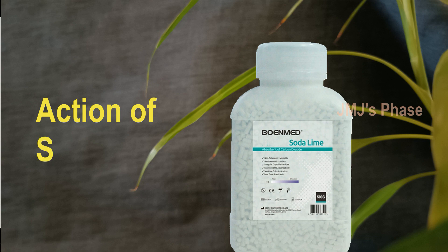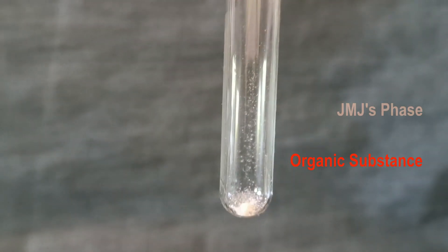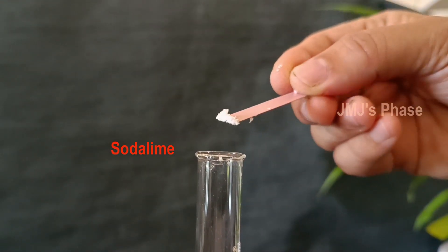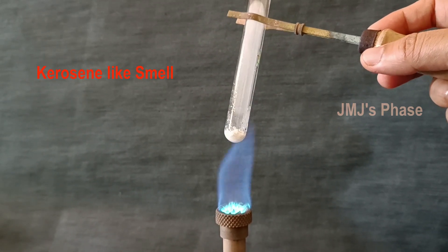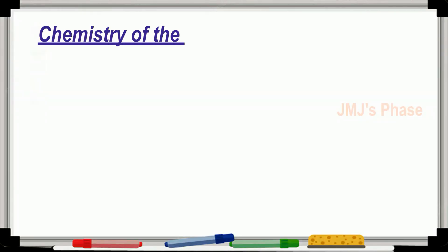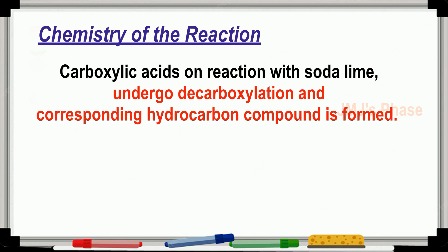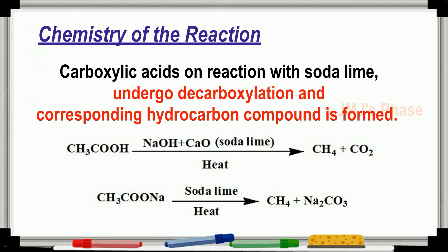Action of soda lime: Take a little of the substance in a dry test tube, add 1 gram of soda lime, and heat it. A kerosene-like smell indicates that the compound is a carboxylic acid. The chemistry behind the reaction is that carboxylic acids react with soda lime, undergoing decarboxylation, and the corresponding hydrocarbon compound is formed.